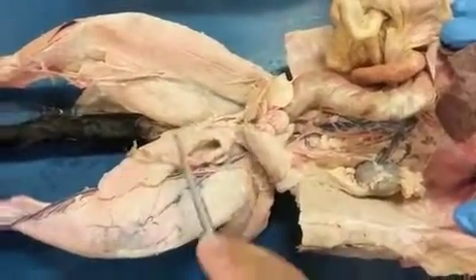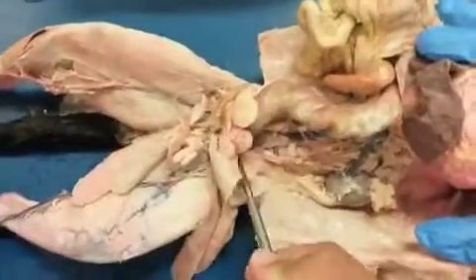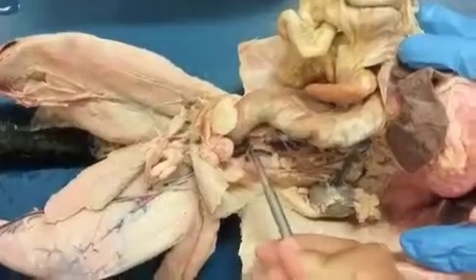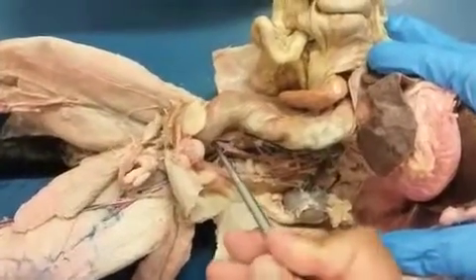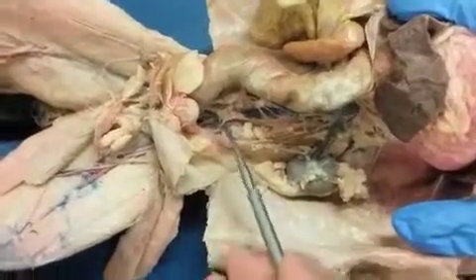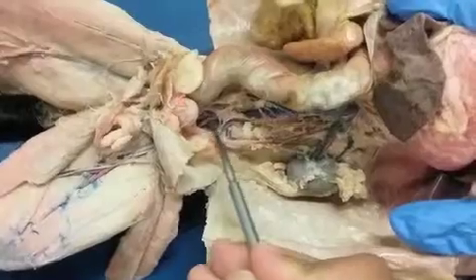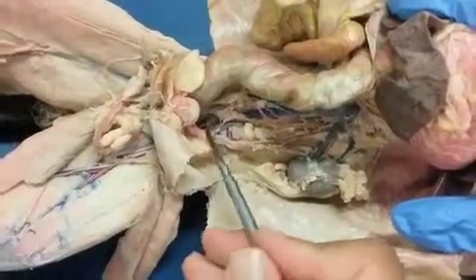If we follow the veins, yeah. Are those really tiny ones up on the board that you have drawn that aren't labeled yet? Those would be the internal iliacs. Okay. Right, so those are even deeper here. I can't even see it right there. There's a connective tissue there. No, I don't see it. Right there, you barely, yeah, you barely see it right there. You see it? So here's the external. Right. And as I go deep, right there is the internal.